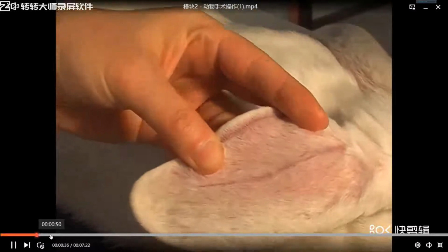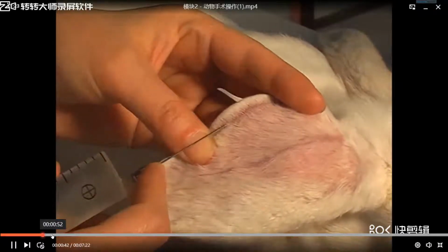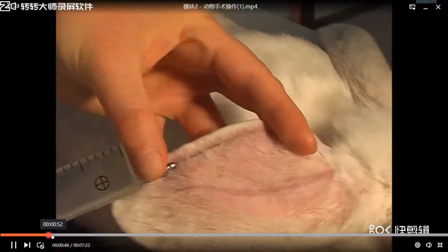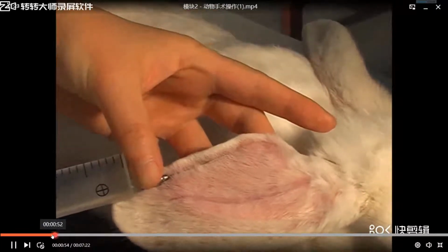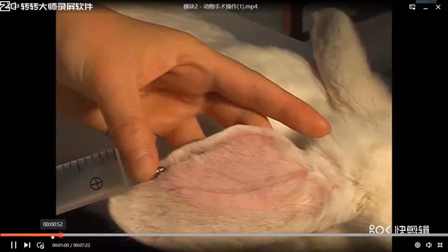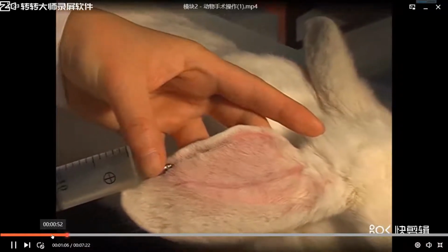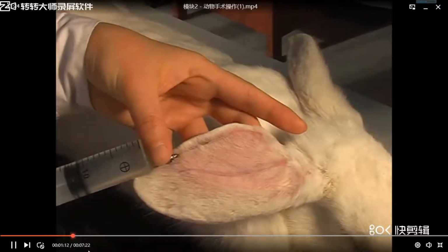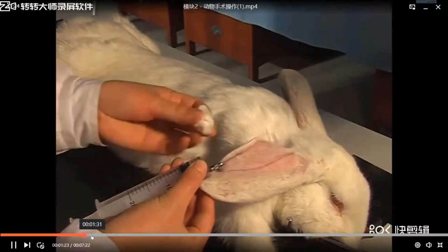Then they find the ear vein and inject urethane. It is superficial, so pay attention to the inserting point. In order to inject smoothly, fix the needle handle with fingers. Pay attention to the injecting speed: first quick, then slow. Cotton ball is used in compression hemostasis after injecting.